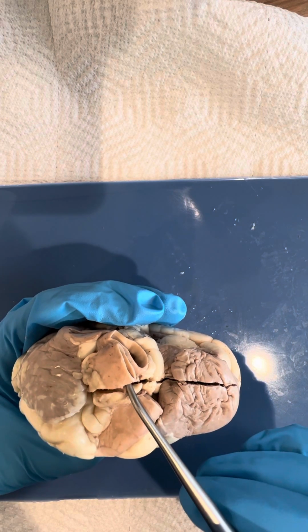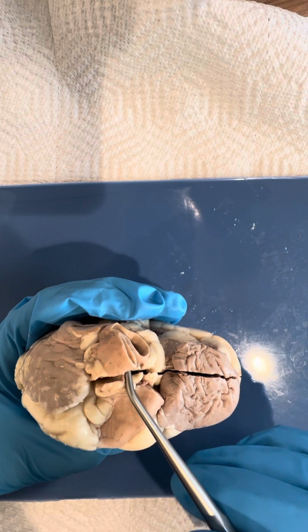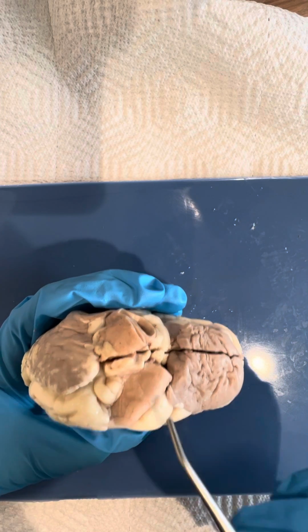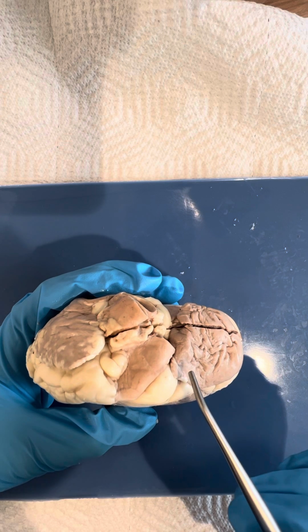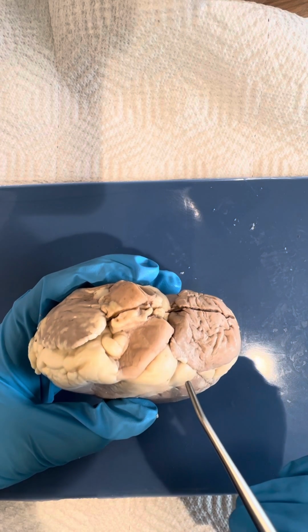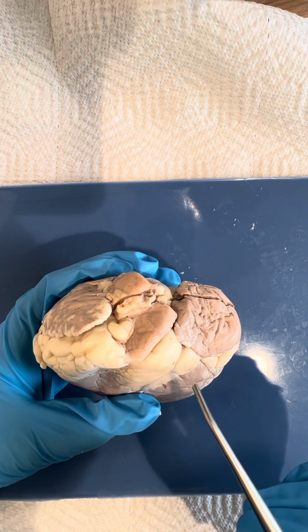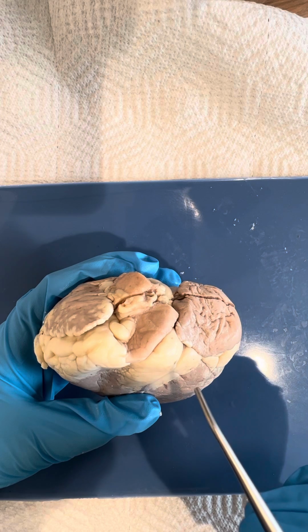The aorta comes from the left ventricle and carries the blood to the systemic circuit. The smaller one, leading from the aorta, that supplies the blood to the heart is called the coronary artery. The brachiocephalic trunk emerges from the aorta and splits into the right subclavian artery and the right common carotid artery.